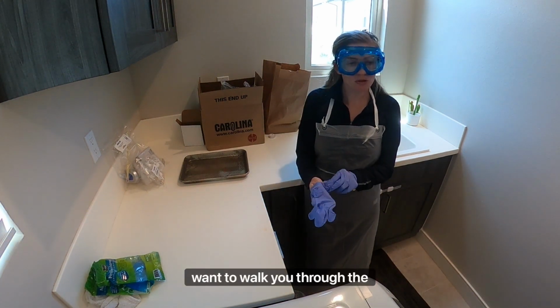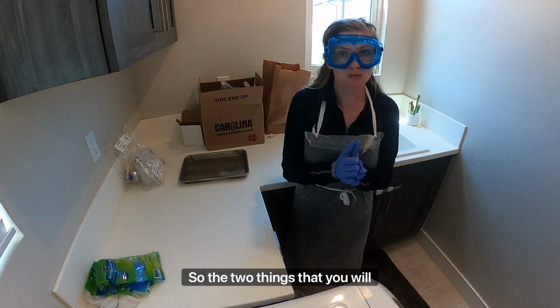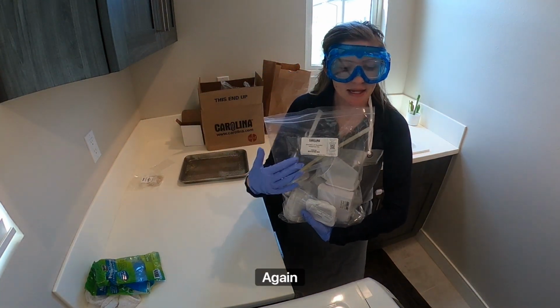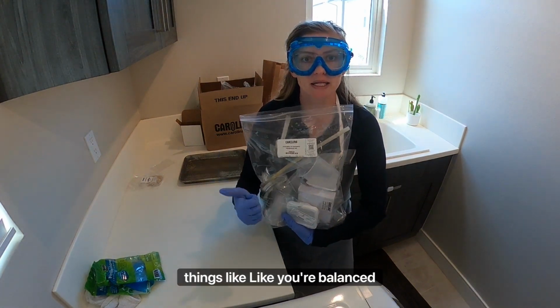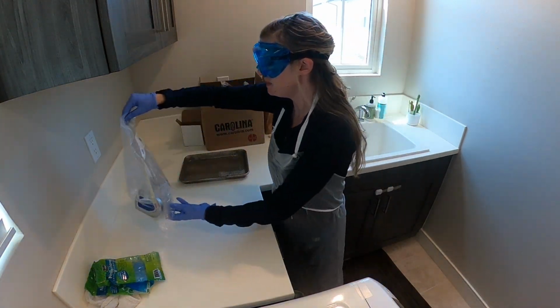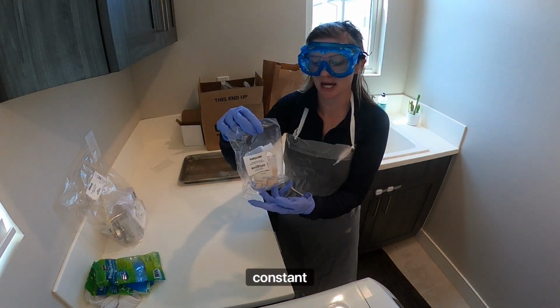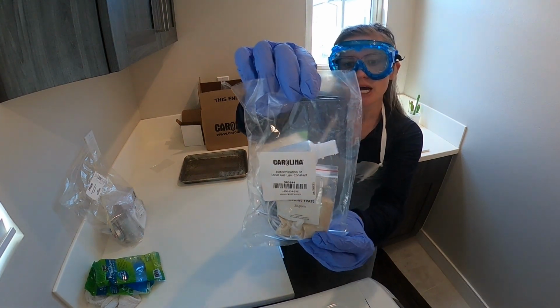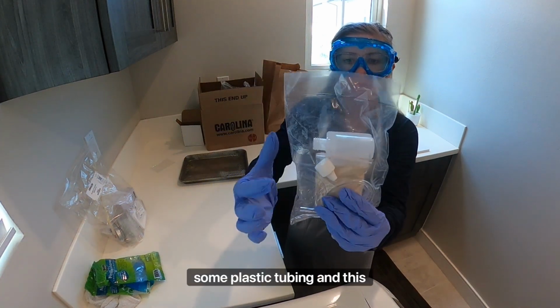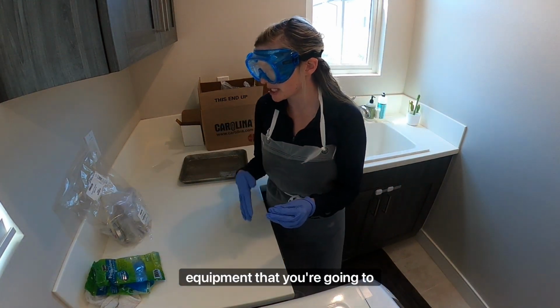Now, I want to walk you through the materials and what you will be needing for this particular lab. The two things that you will need to grab are your Principles of Chemistry equipment set, which contains things like your balance, weigh boats, graduated cylinders, etc. So you want to grab this bag. The other thing that you want to grab is the Determination of Ideal Gas Law Constant equipment set. It'll look like this. Essentially, there should be a bag of yeast, some plastic tubing, and this sort of plastic vial. So these are the two pieces of equipment that you're gonna need.